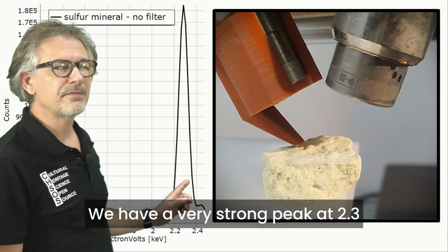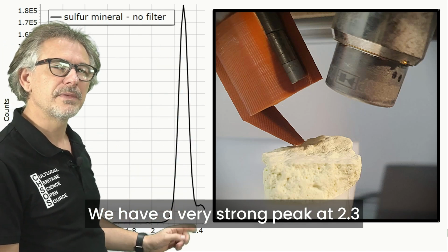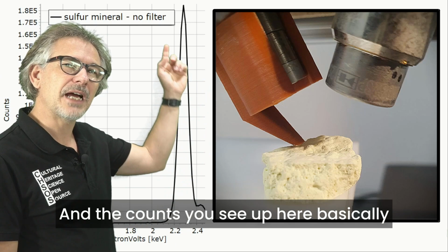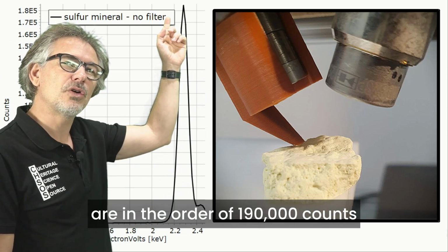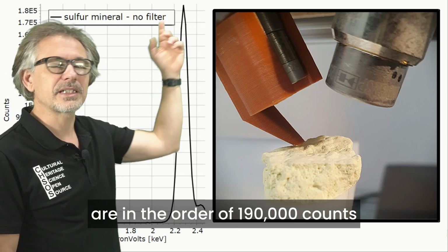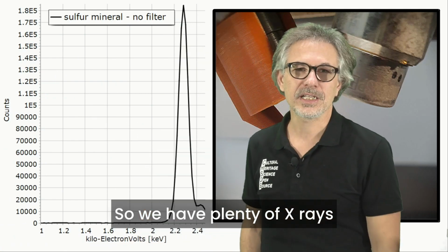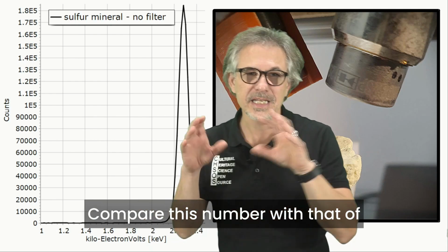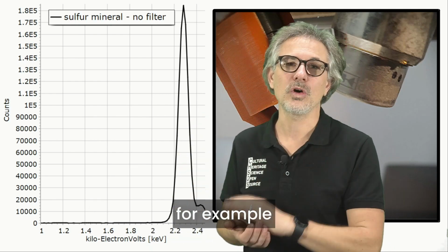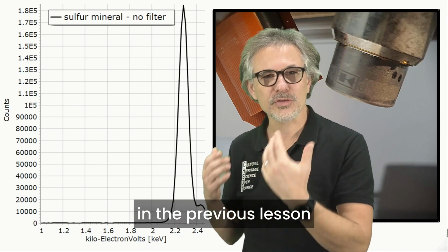This is the spectrum of the sulfur mineral, so just sulfur. We have a very strong peak at 2.3, and the counts you see up here are in the order of 190,000 counts. So we have plenty of X-rays. Compare this number with that of, for example, aluminum that we saw in the previous lesson.